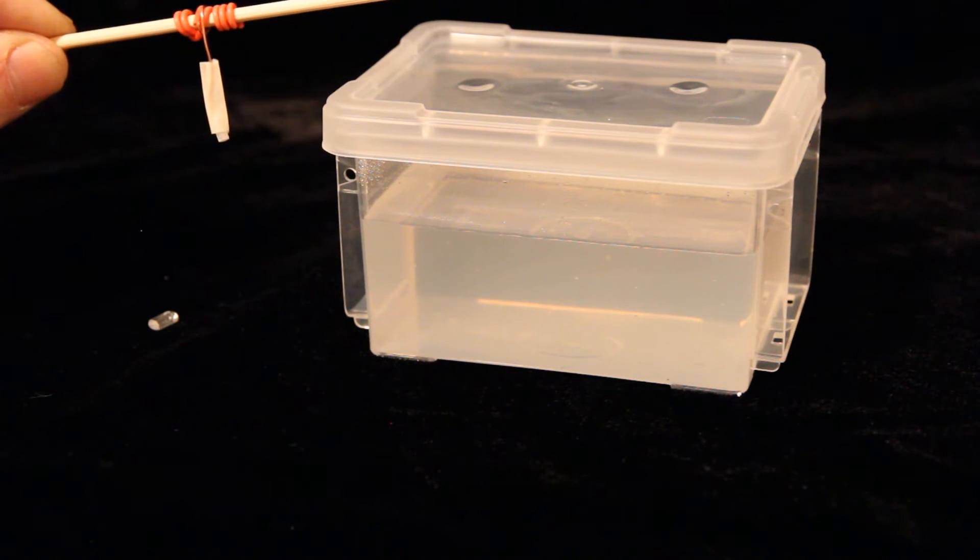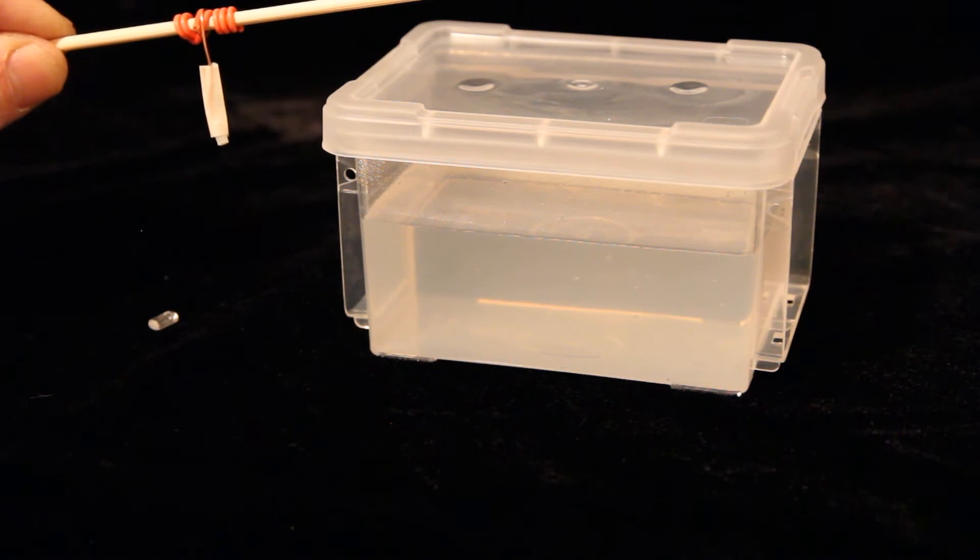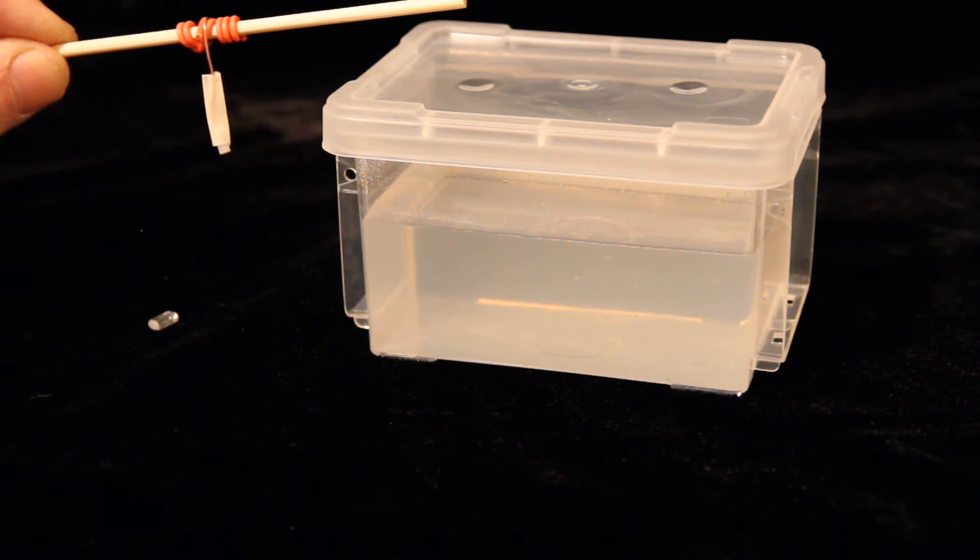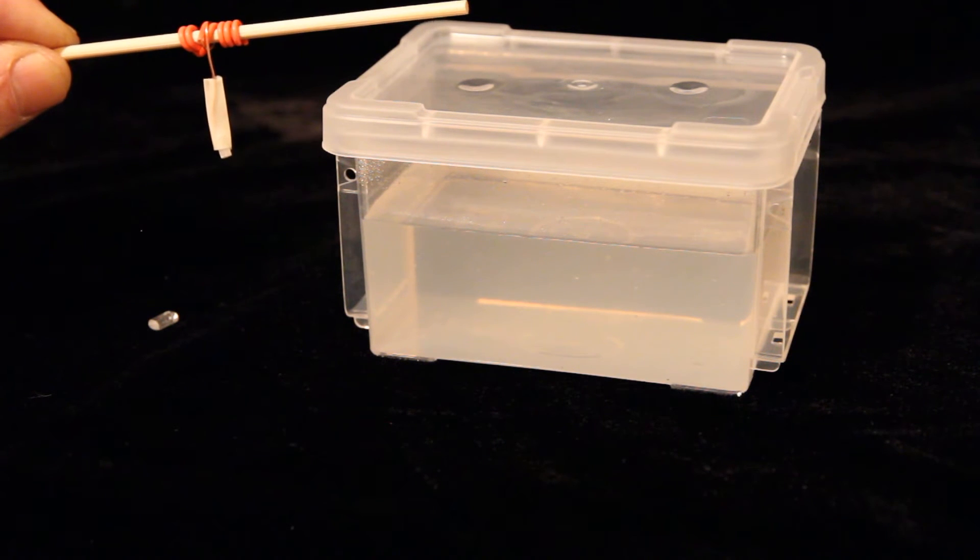And within 30 seconds to a minute, the container will be completely filled with crystal growth. This rapid growth is what makes this great for school demonstrations.